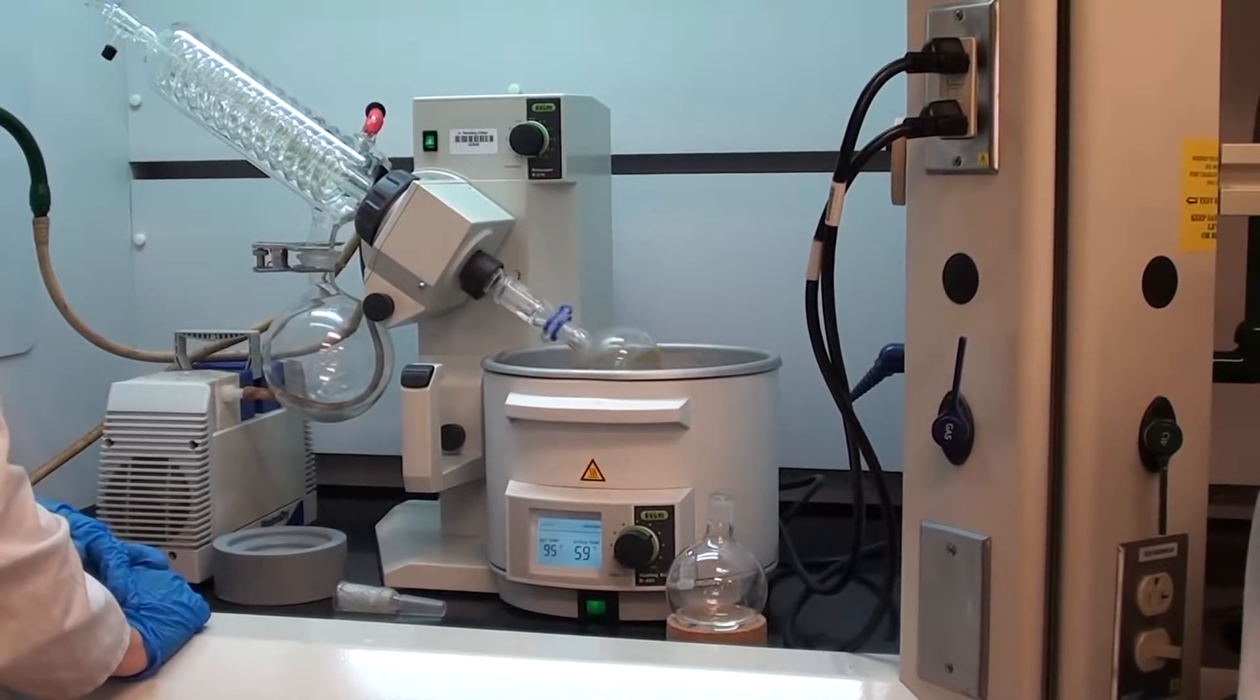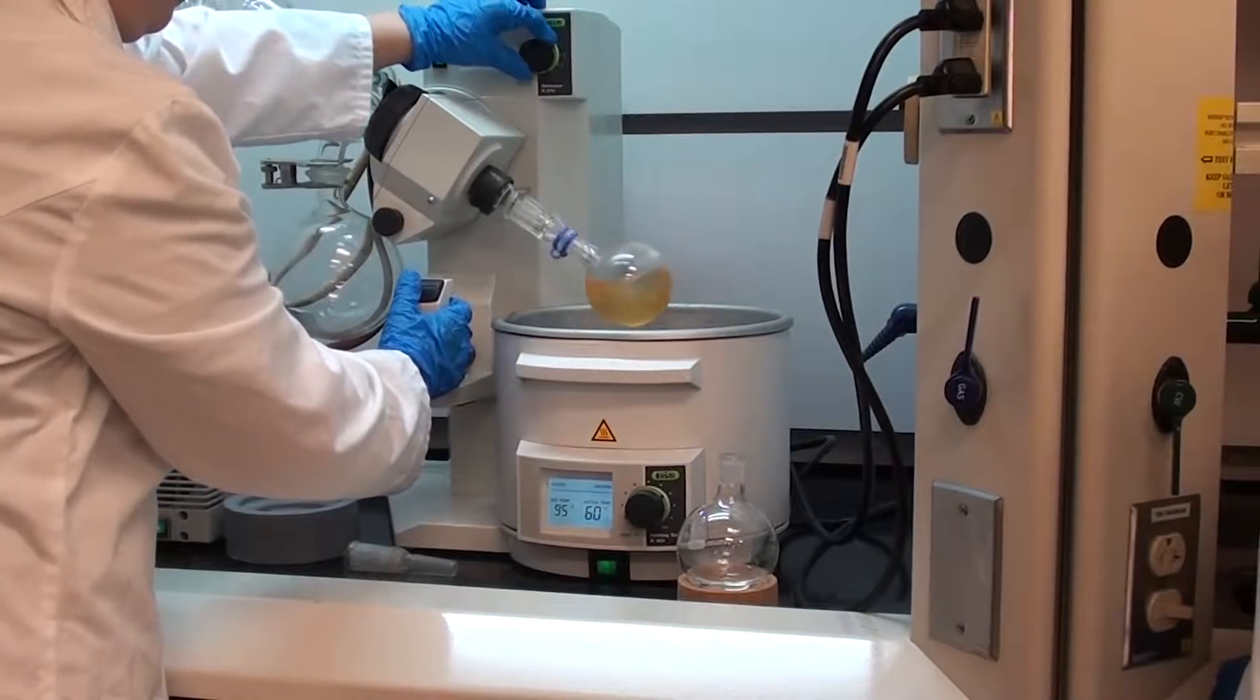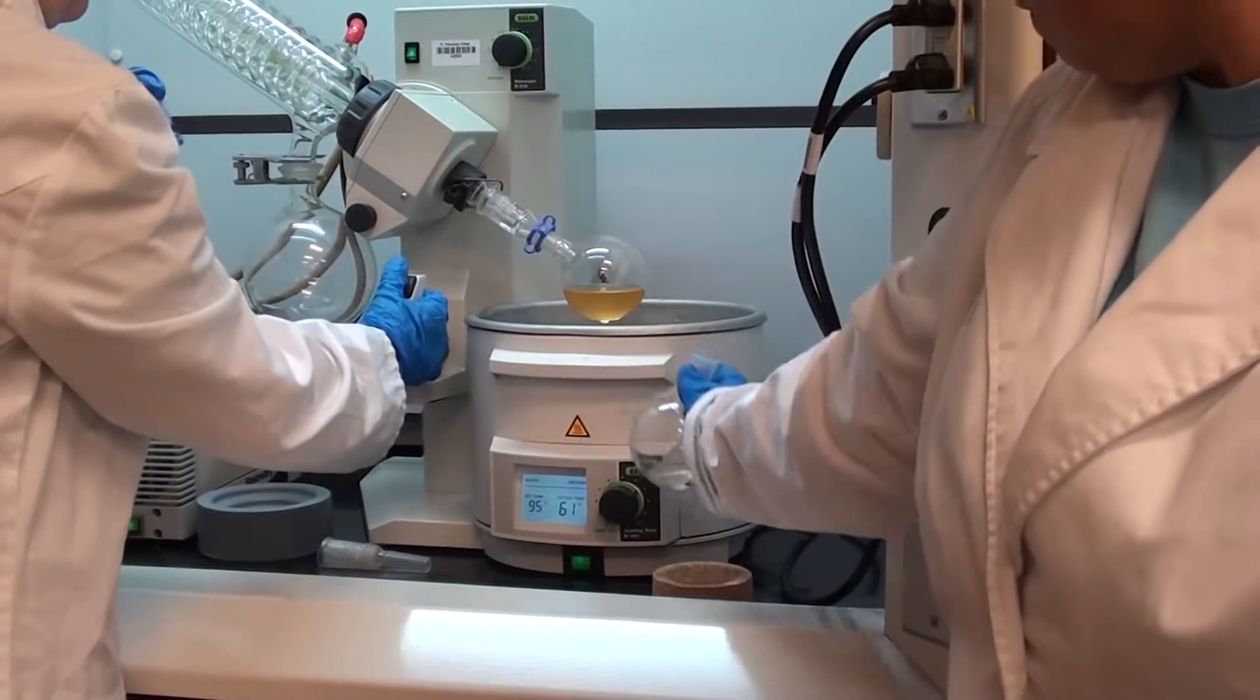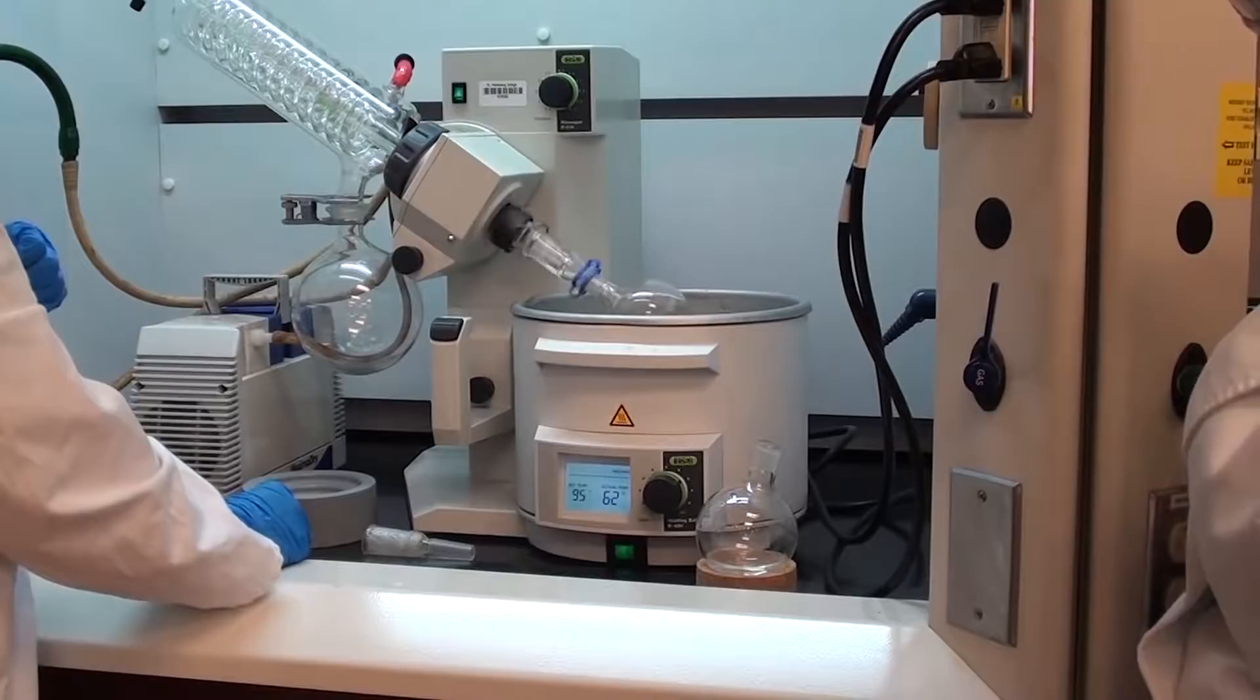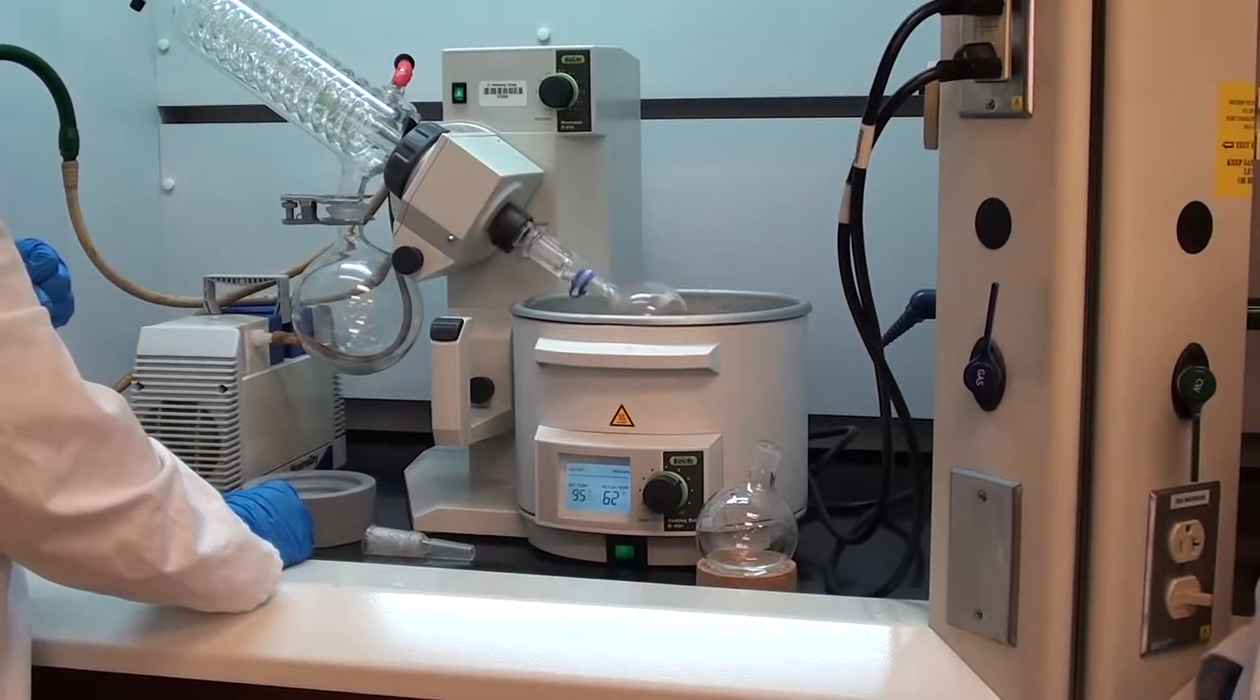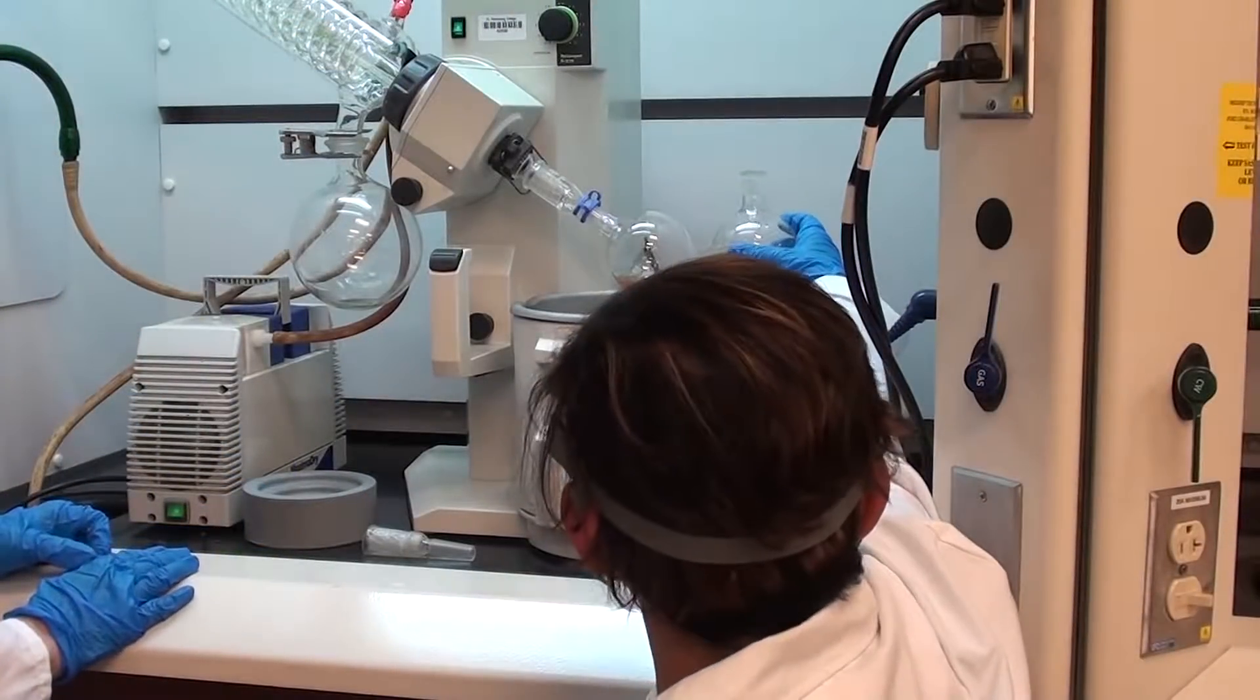Now what Jen's going to do is at some point, she's going to turn off the spinner and lift it out, and then she's going to compare it with the level that's in the flask down below. Let's take it out of the water and see where we're at, just to get an idea. You can see, could you put the other one beside it for reference? As you can see, we're nowhere near 30 mL yet. So we're going to take that down and continue with the process. But that gives you an idea - you can't do this just by leaving it sit because you won't be able to see the level. Occasionally you're going to have to stop it and pull it out of the water to see what the level's like. Shouldn't take very long though. Let's lift it up. Stop the spinner, let's put it beside it. Looks pretty good to me. It looks like it's 30 mL.